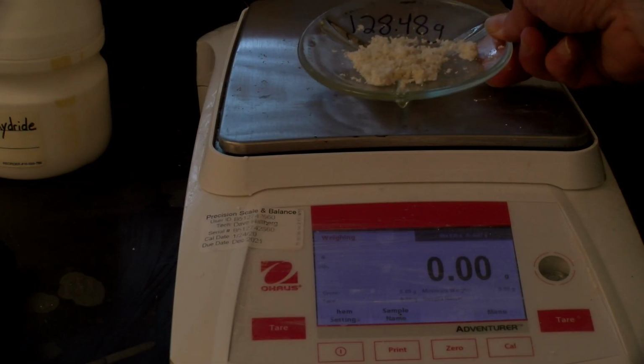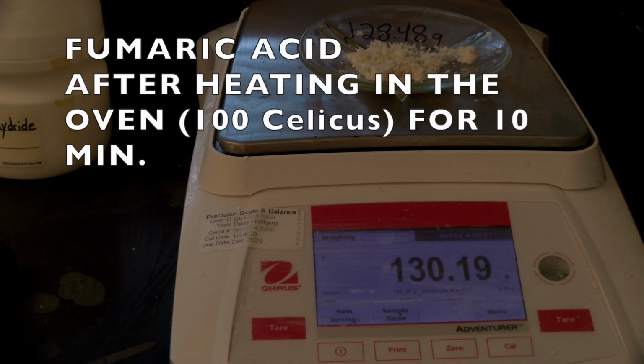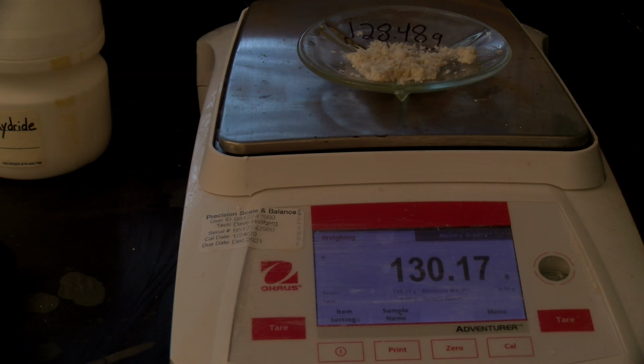So we've zeroed the balance. This is the second of the two products, the fumaric acid. Remember, our watch glass weight was 128.48. And this one, about 2 grams or so, a little less, 130.18. And remember, this was a heating that was initially for about 10 minutes. All right, so we only went about 10 minutes for this first heating, and it was pretty dry already, I thought, so I thought we'd get away with that. So we'll see how it is. We'll put this back in for 10 more minutes and see if we get something close to this 130.18.